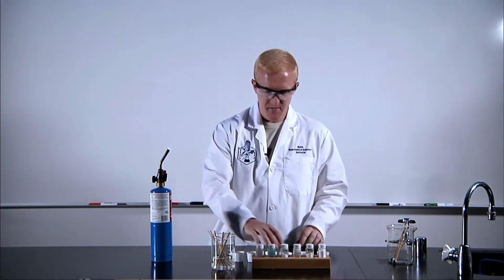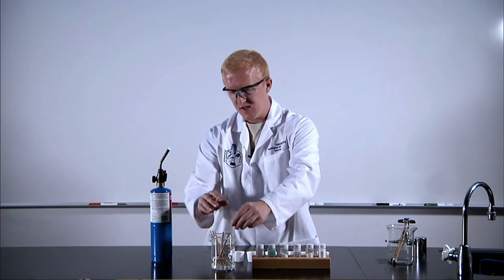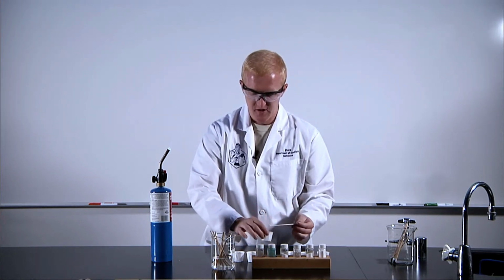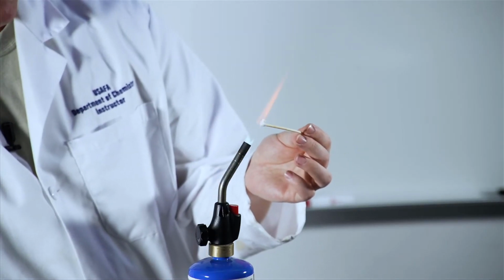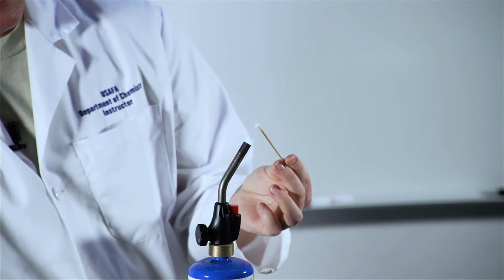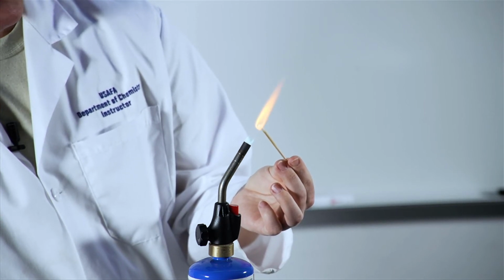Next up, we're going to look at calcium chloride. So moving over in the periodic table, let's see what we get. Hopefully, we would expect a similar color, but let's see what we can see here. We don't see that. It has to melt a little bit first, but now we get sort of an orange color, really not on the red side, more of an orange color.